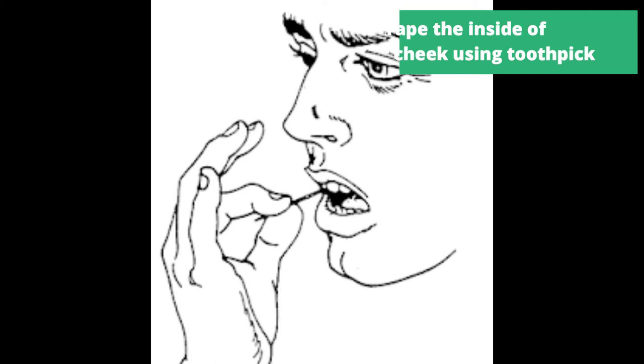All right, now we're going to take some cheek cells and view them on a microscope. So you take a toothpick and you scrape your cheek, scrape the sides of your cheek in order to get a sample of cheek cells.